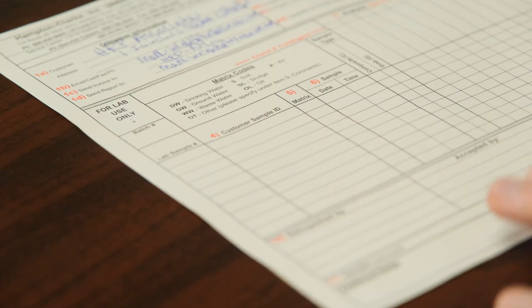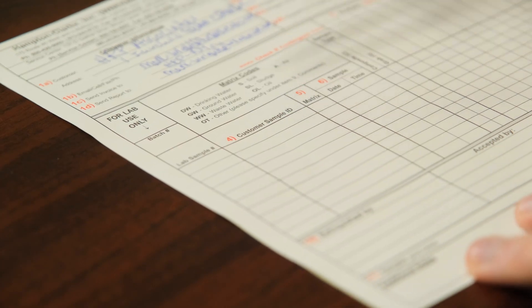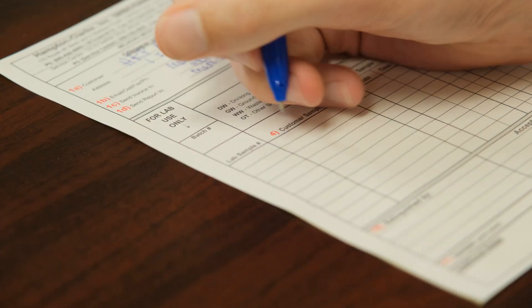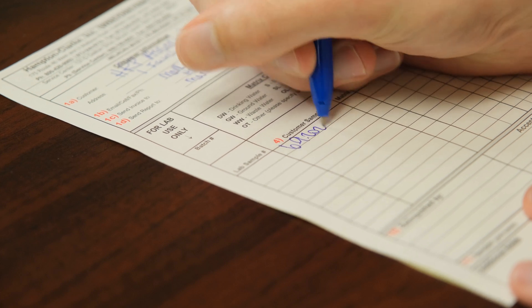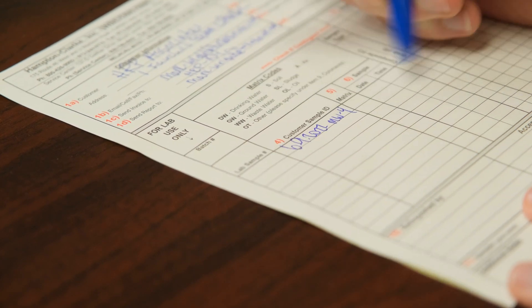Now you can get into the customer sample ID. This is the most important part of the chain — you want to make sure you document all your samples, what type of samples they are, how you collected them, and lastly what sort of analysis you want to run. Another important thing: if you know you're going to be resampling from a certain point, particularly wells, you always want to make sure that you put a date on your sample ID. It could be 6-8-22 as an example, and then your sample ID, which would be MW4, MW6, whatever it may be.